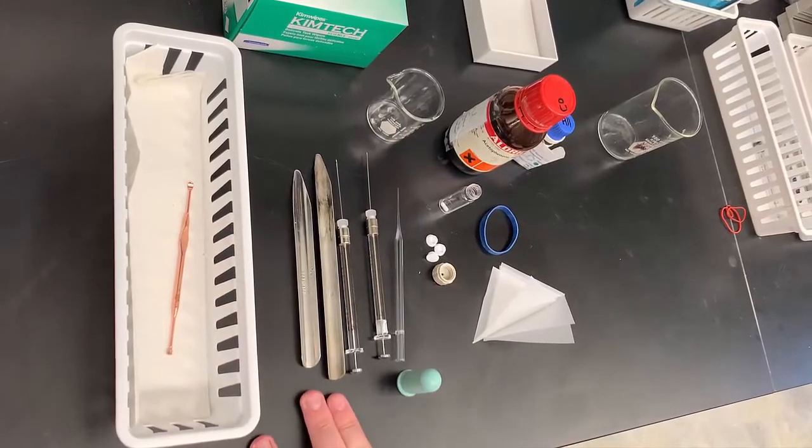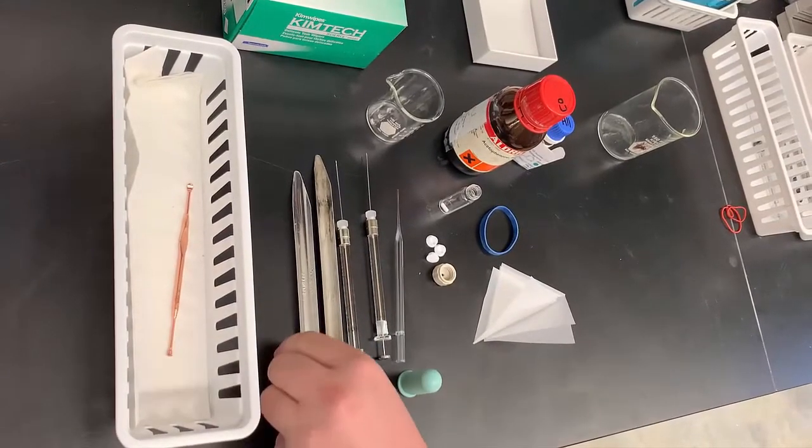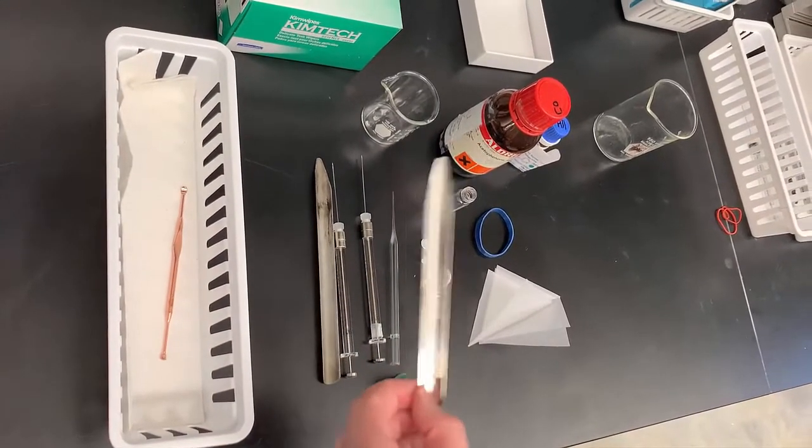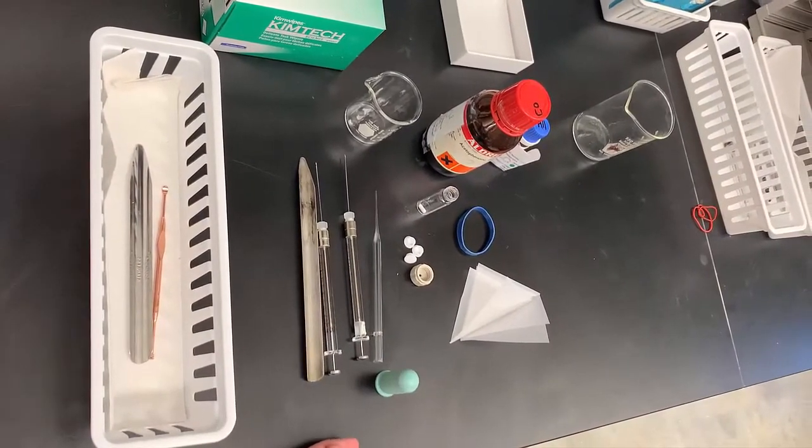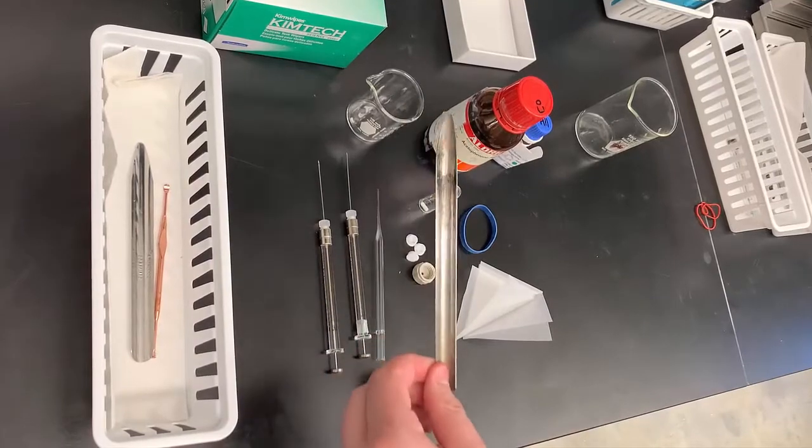Next, you need at least one spatula for the NaO-TBU, which is our base. If you have a solid reagent as well, you may need to bring in an extra spatula.